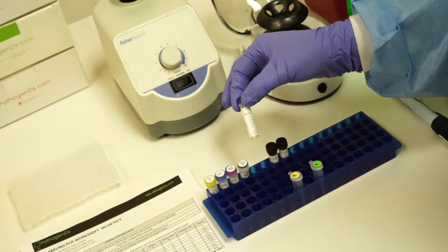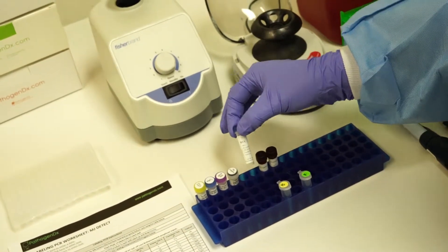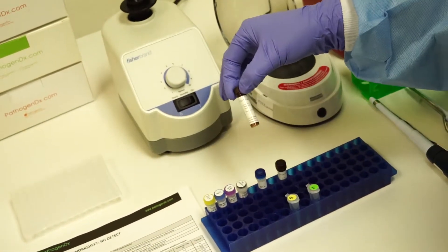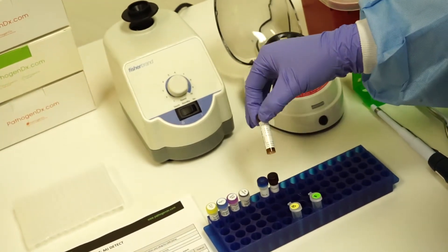Pathogen DX provides the BSA, which should now be at a working concentration, and primer set 2 for bacteria and primer set 2 for fungal.